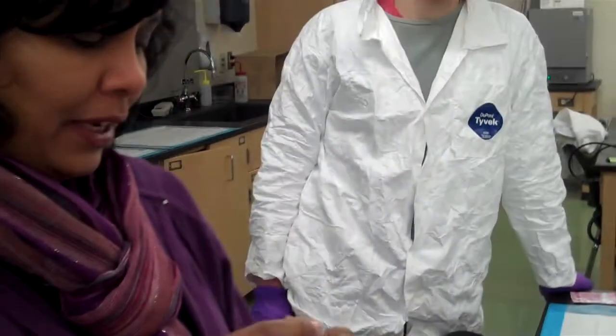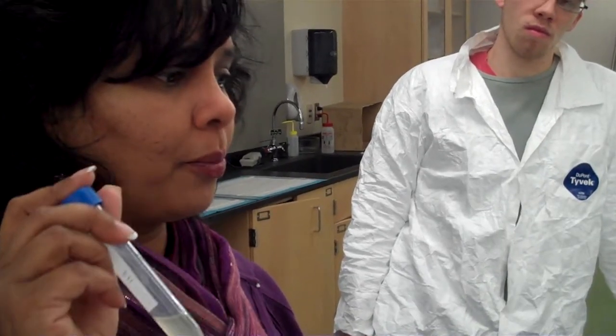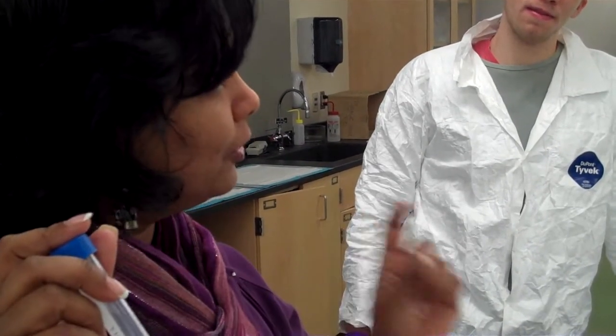Now, we have 3 milliliters in here, right? And we want to get all the cells from these 3 milliliters into one of those Eppendorf tubes. The Eppendorf tube holds only about 1.5 milliliters. And remember, you're going to use your pipetters to transfer this. So how would you get 3 milliliters? This is like one of those word problems in math. How are you going to get 3 milliliters worth of cells out of this into a tube that only holds 1.5 milliliters? You separate them, and so you only take a certain part.